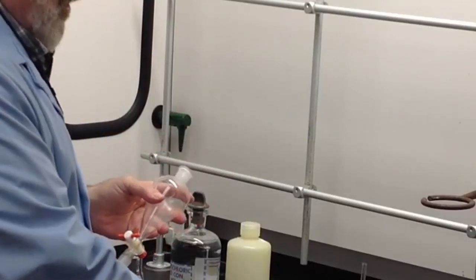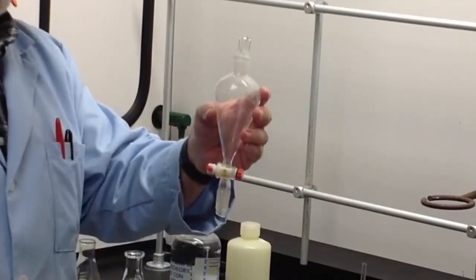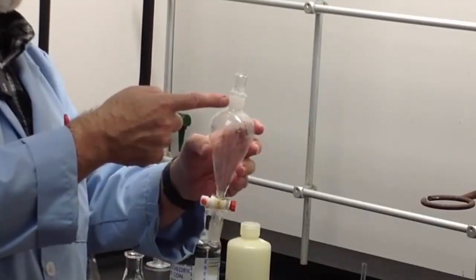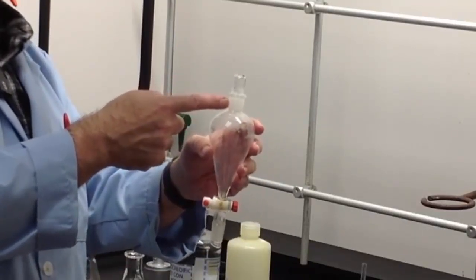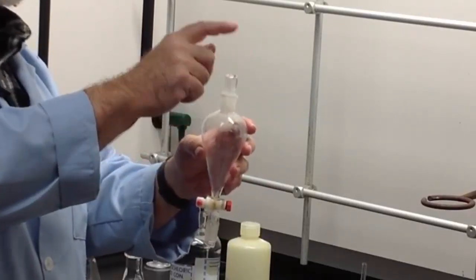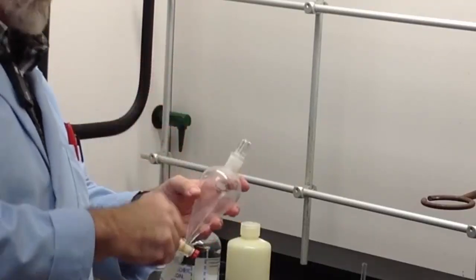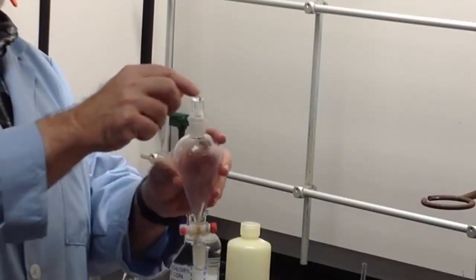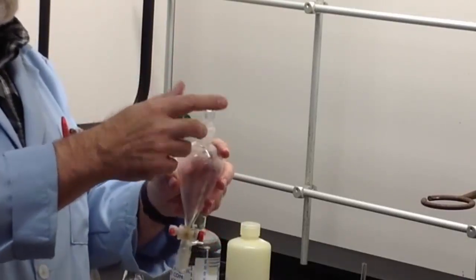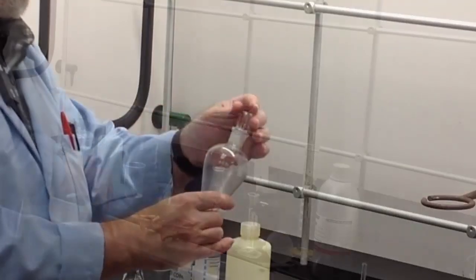The second thing you want to check is your stopper. Make sure that the stopper is a good match for the top of the funnel. That is, the ground glass joint of the stopper and the ground glass of the funnel should be the same length and the same size, and that when it goes together they make a good fit. Some of you will have plastic stoppers. There's nothing wrong with using a plastic stopper on a separatory funnel. Personally, I prefer glass, but that's a personal issue.